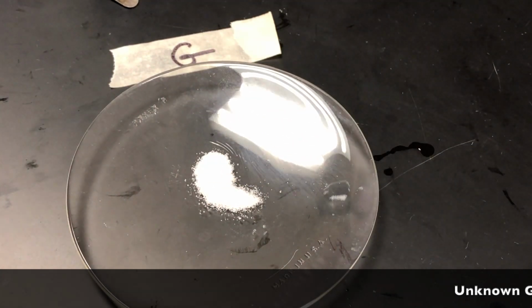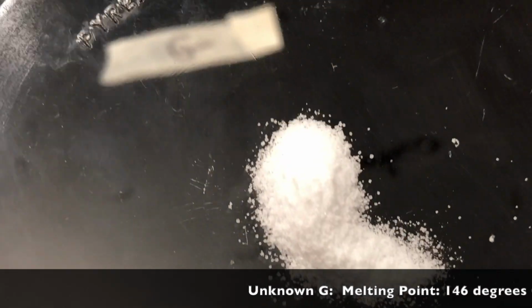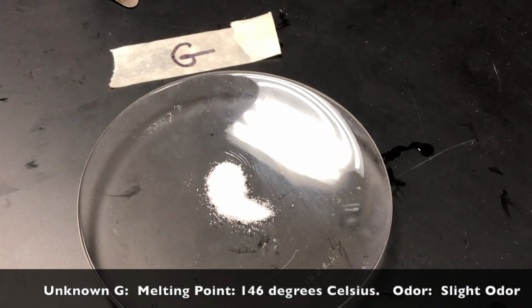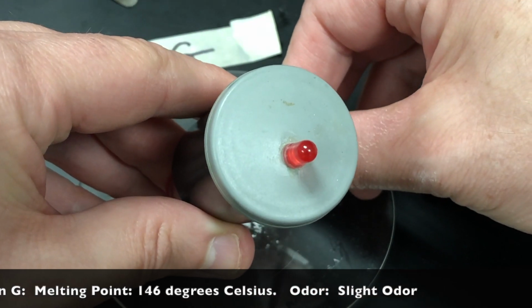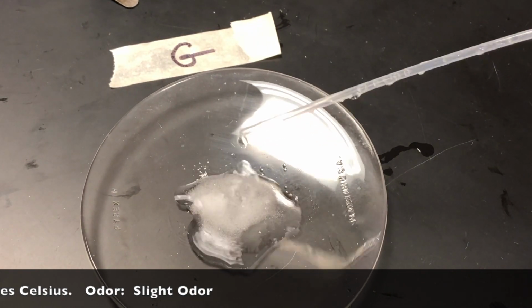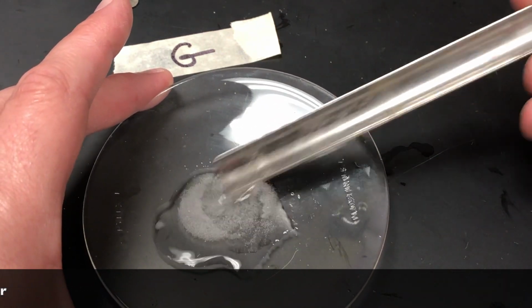This is our last unknown, unknown G. Again, hopefully you've been keeping track of the melting point information and the odor information. If you missed any of these, then of course feel free to rewind and watch again and make careful note of the data that is being presented to you in the ticker.